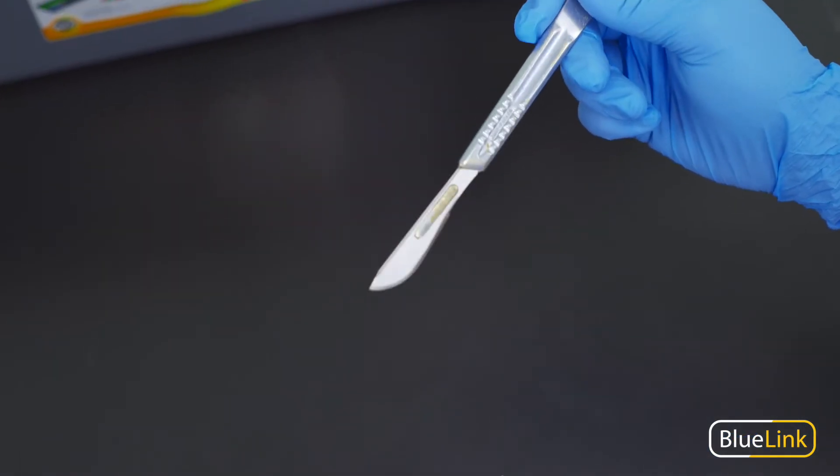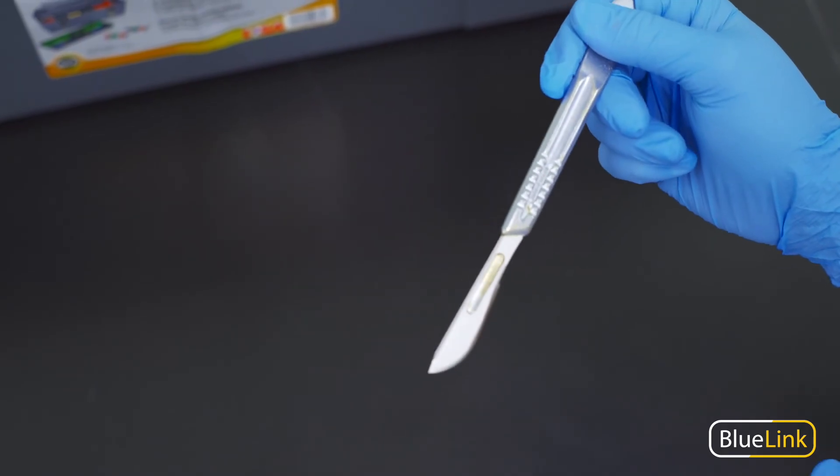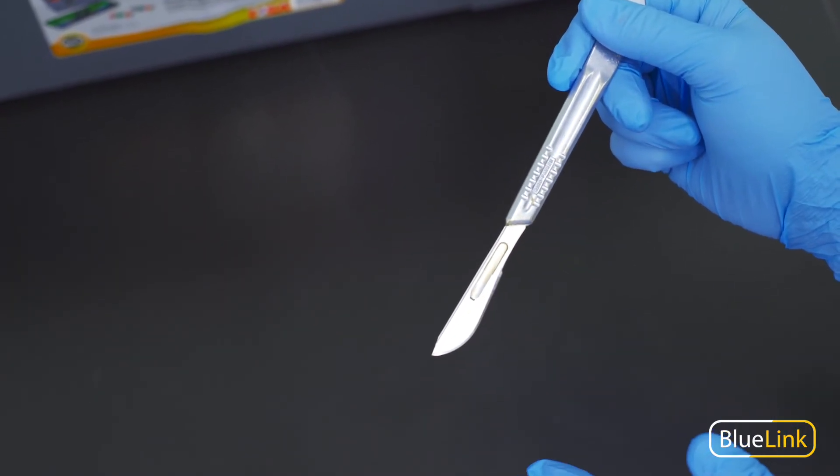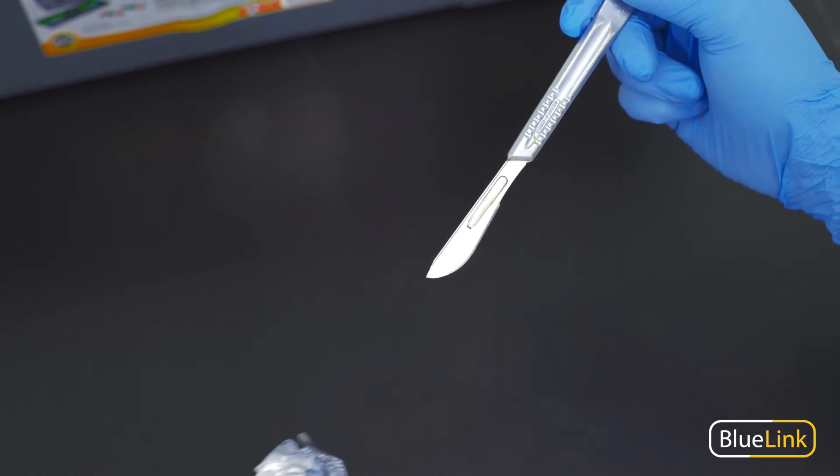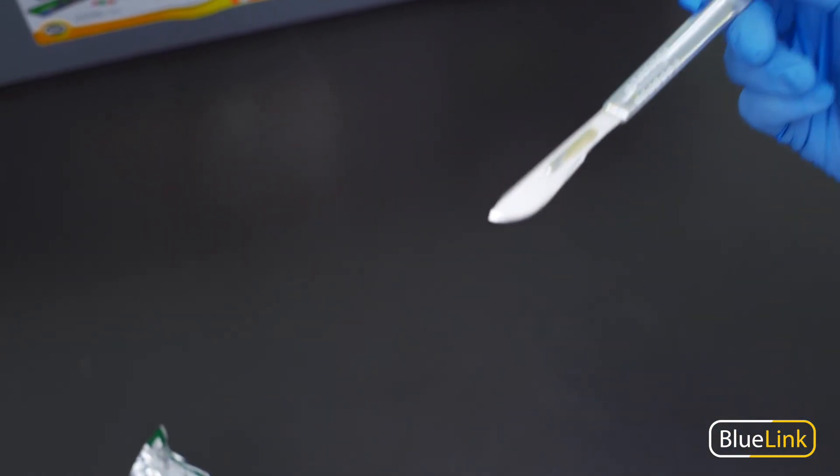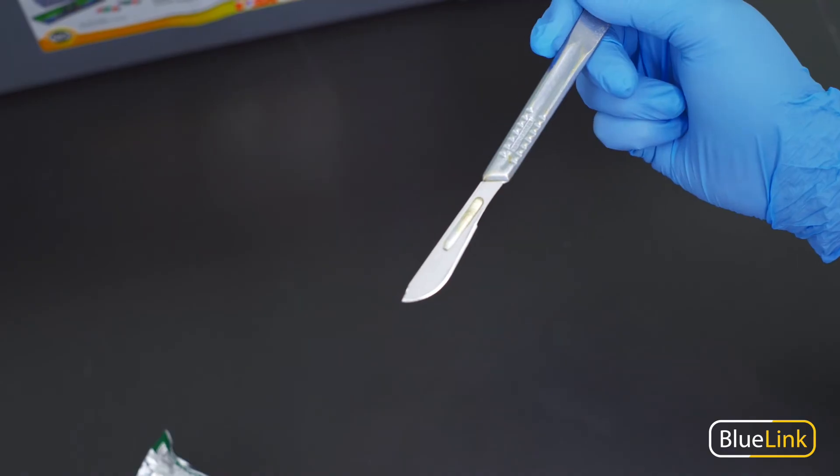If the blade ever comes loose from the handle or falls out of the packaging for some reason, it's best to never handle the blade with your hand. Use a pair of forceps to handle them and get a good grip so that you're not going to accidentally cut yourself and to prevent injury.